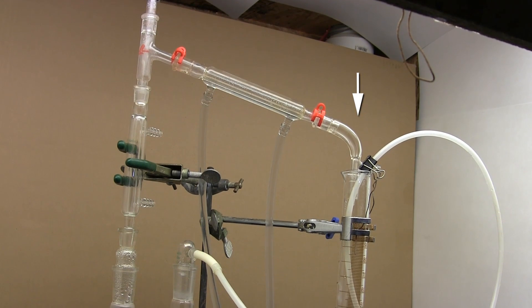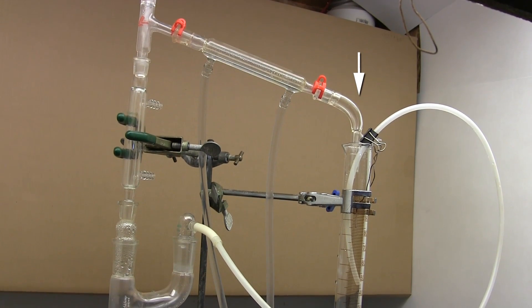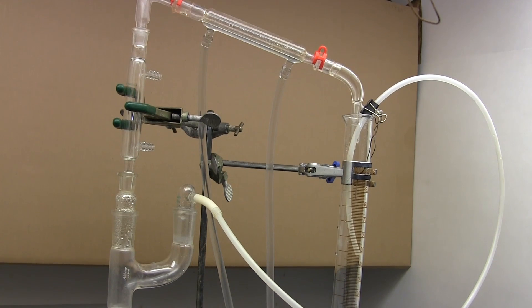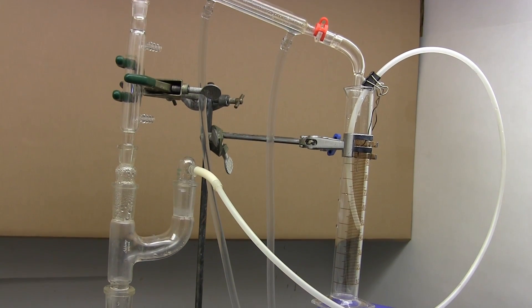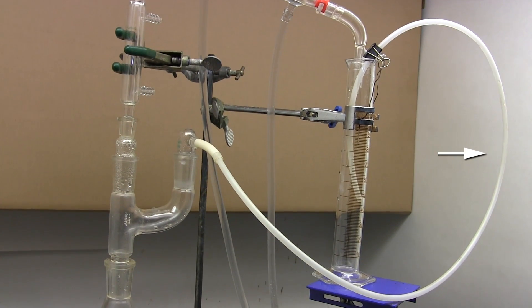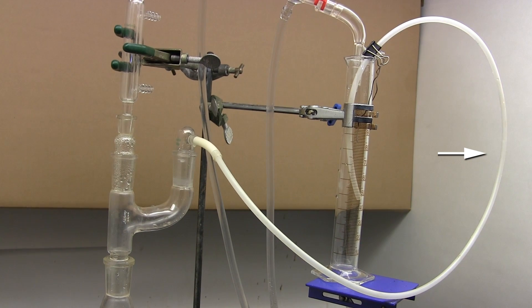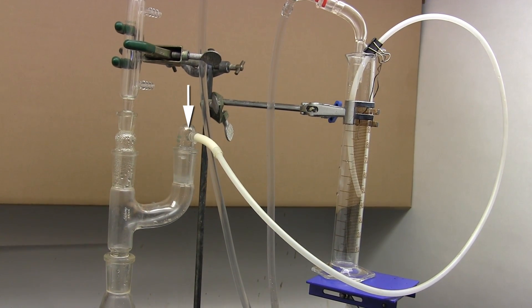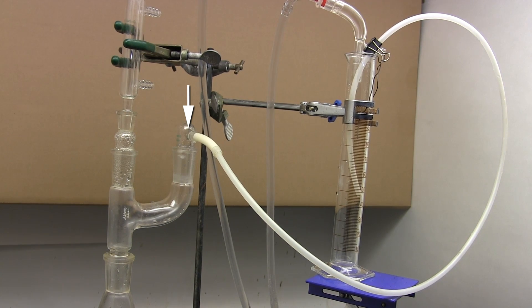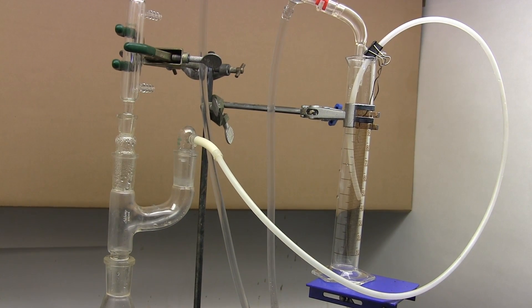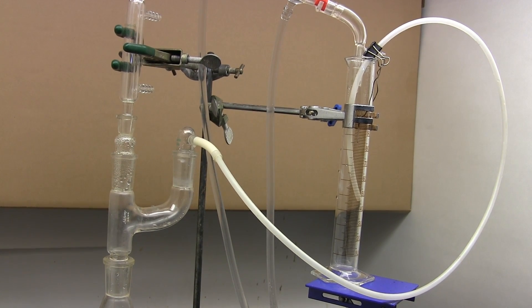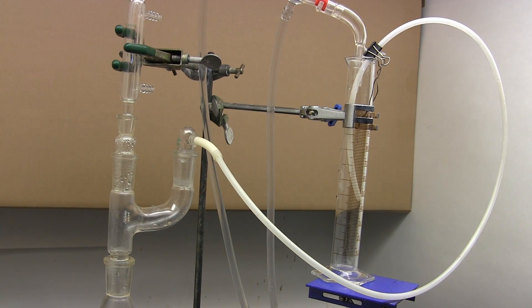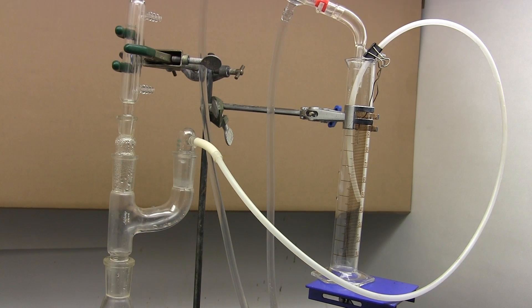At the end we have our distillation adapter, although this is optional if you tilt the graduated cylinder down here. Now key to the whole operation is this tube that siphons out liquids in the graduated cylinder and sends them to this hose adapter that connects to the Claisen adapter and returns liquids to the boiling flask. Now because this system is dependent on siphon action to work, it must be properly aligned and prefilled before you start. Unlike a professional trap that can run empty.